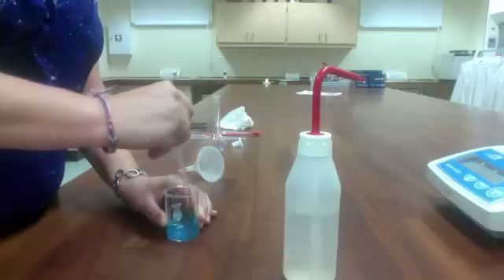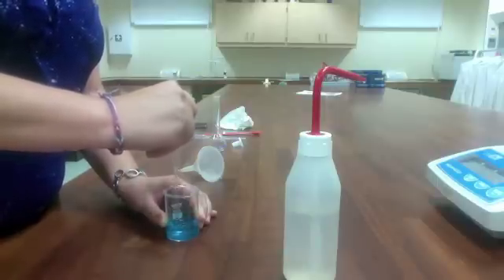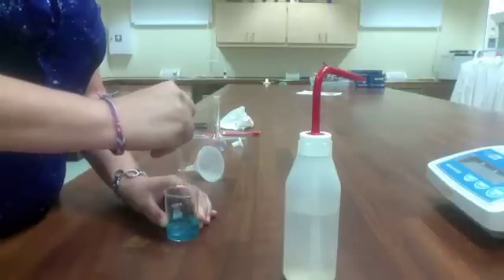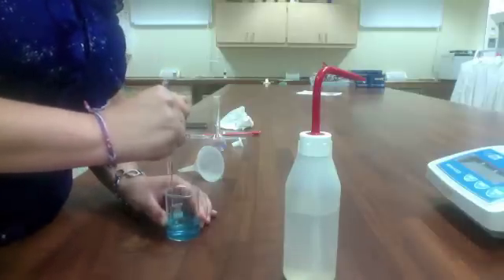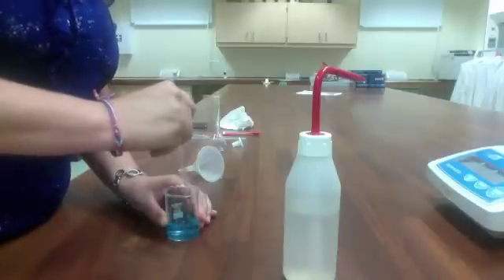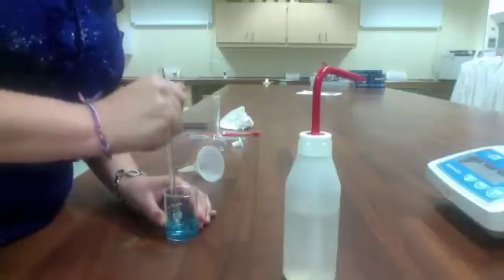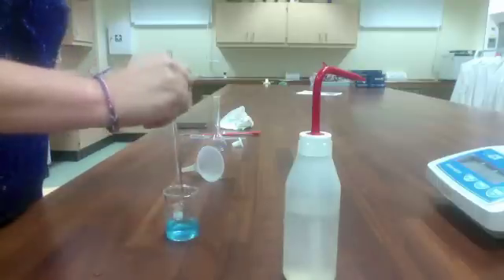What we're doing is dissolving. It's much easier to dissolve the solid in a beaker than it is in the volumetric flask. Using the stirring rod, I'll stir until all my solid is dissolved.